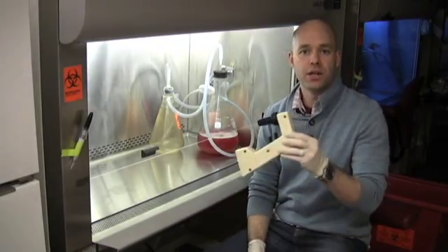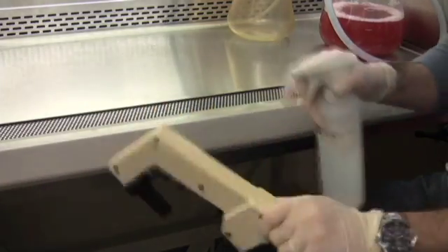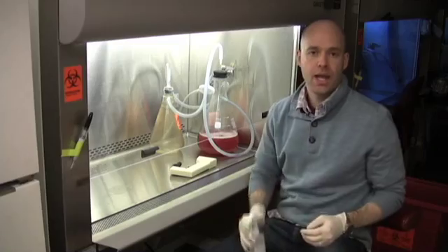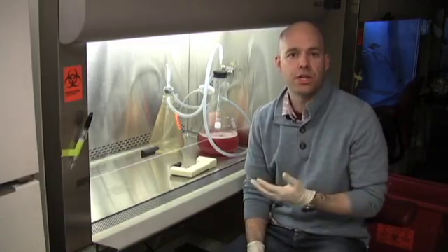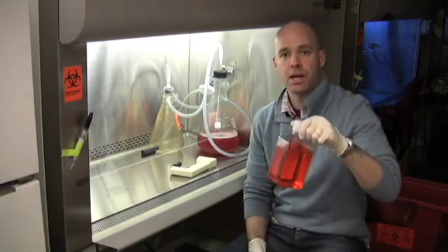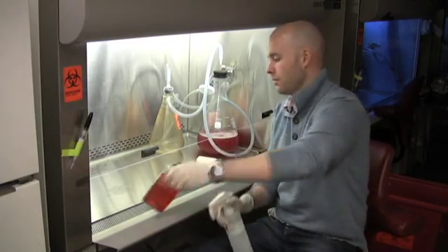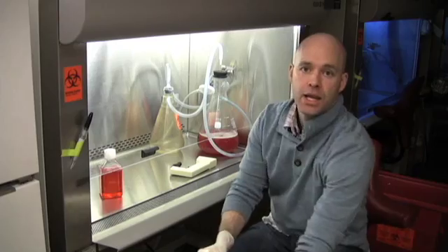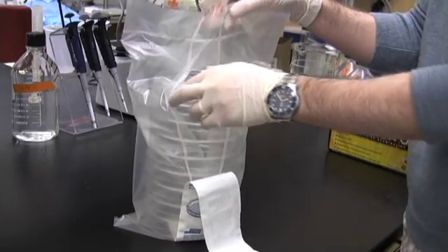So when working in the hood the first thing you're going to use is a pipet aid. So spray it down. And for the purposes of this demonstration we're going to work with a generic bottle of media and a tissue culture dish which should be sterile coming from the packaging.